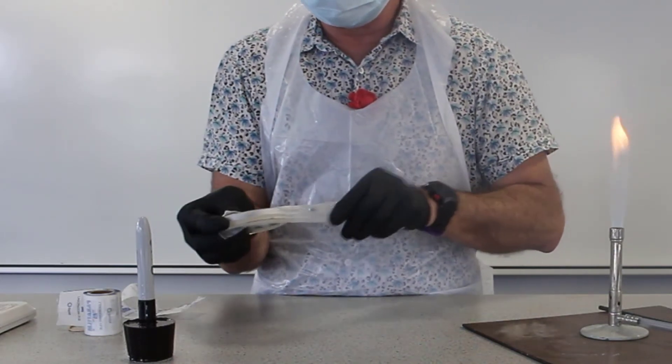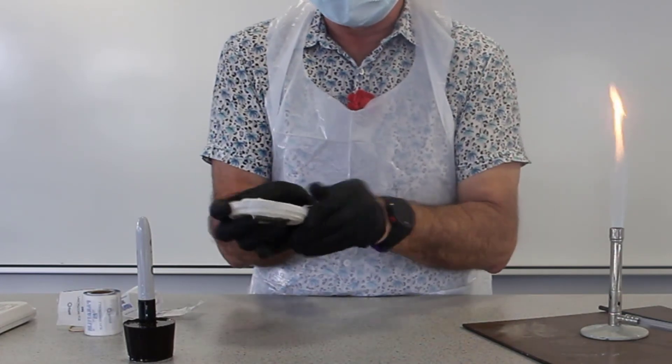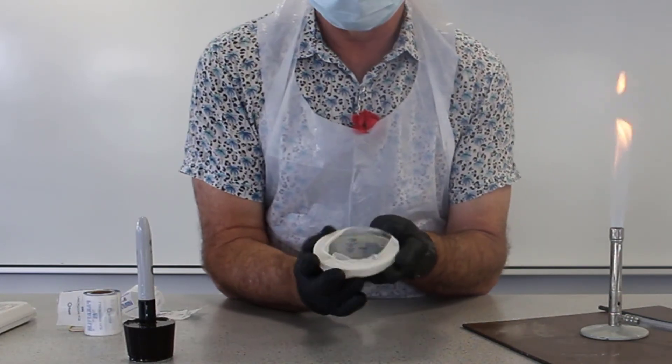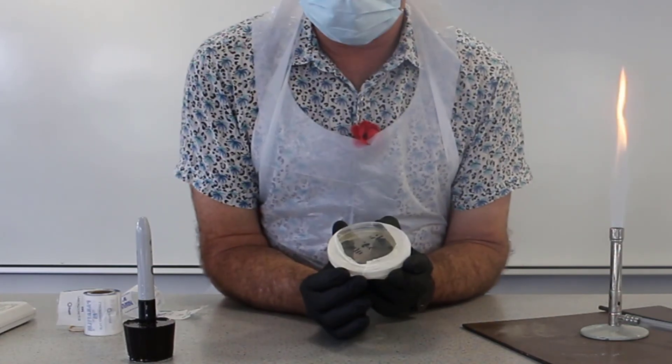Okay, we've already labeled it. We just stretch the parafilm around it and that's ready to go in the incubator for 48 hours until we're ready to test the bacteria.